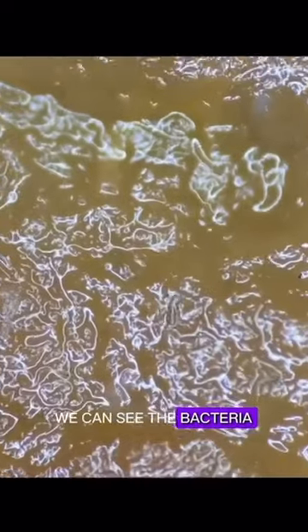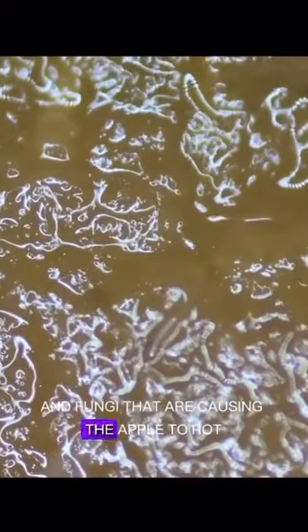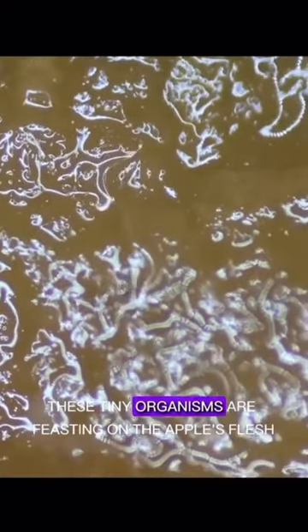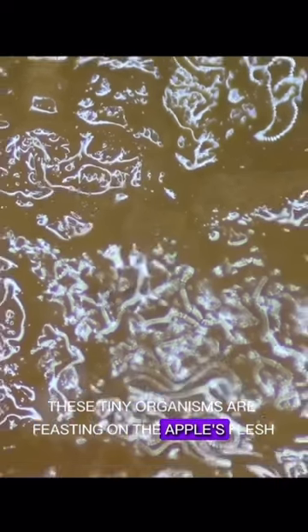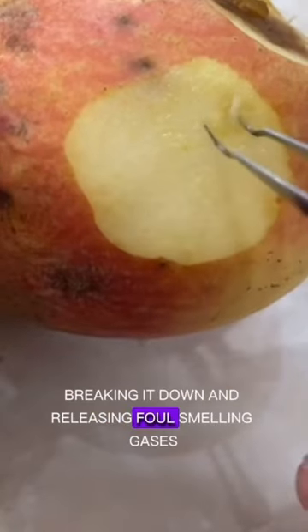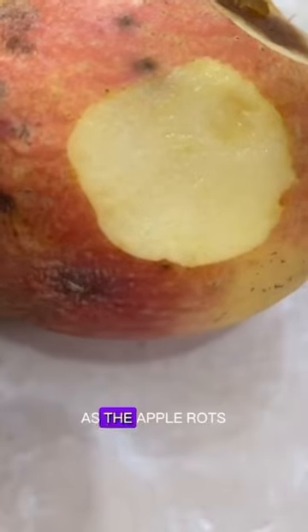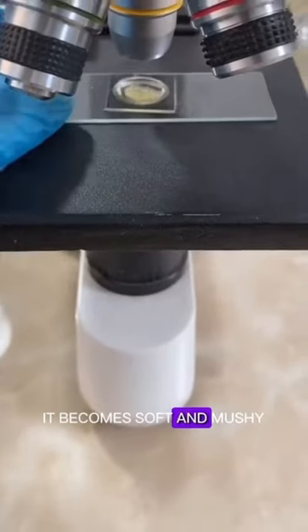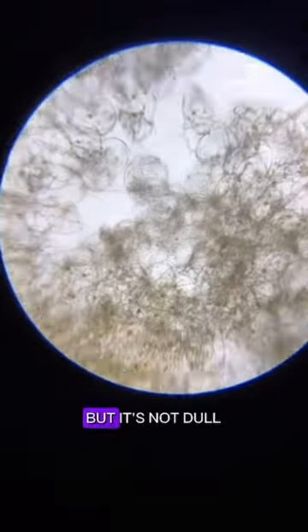We can see the bacteria and fungi that are causing the apple to rot. These tiny organisms are feasting on the apple's flesh, breaking it down and releasing foul-smelling gases. As the apple rots, it becomes soft and mushy, and eventually it will fall off the tree.